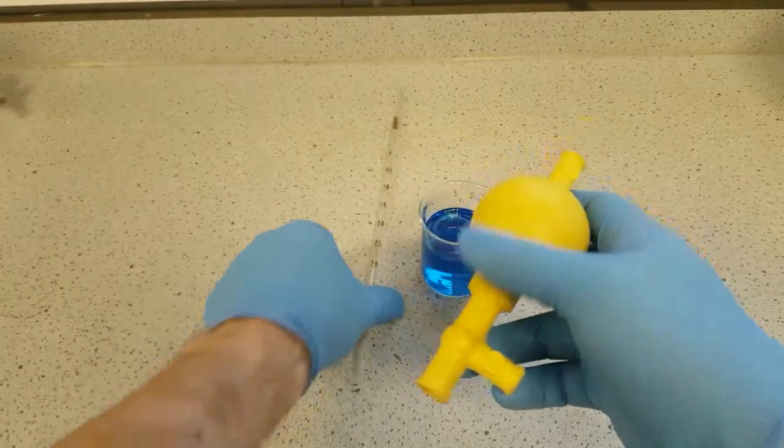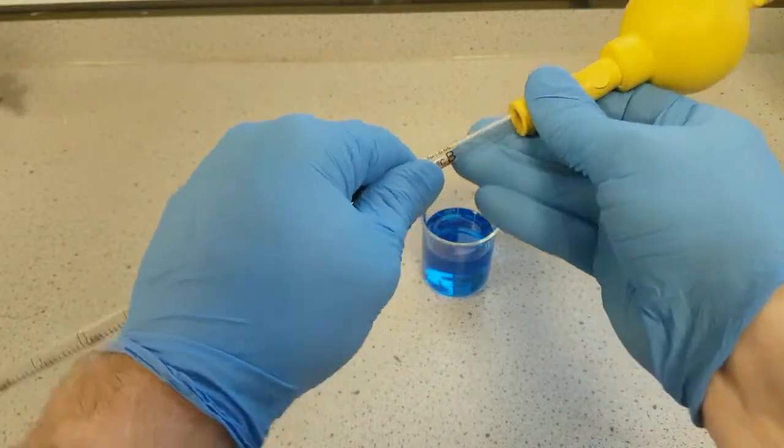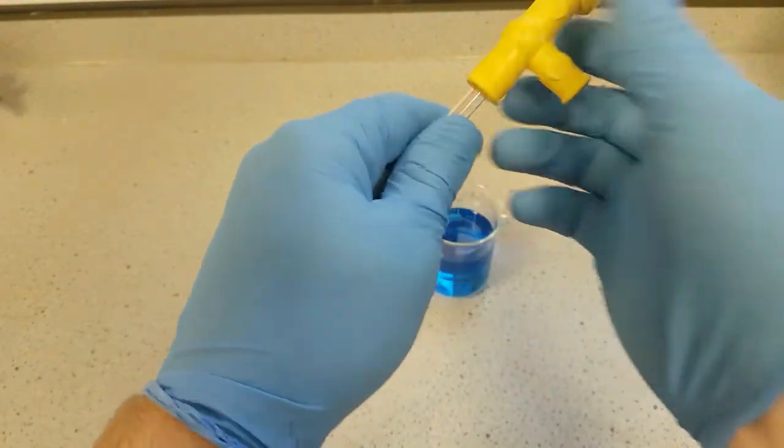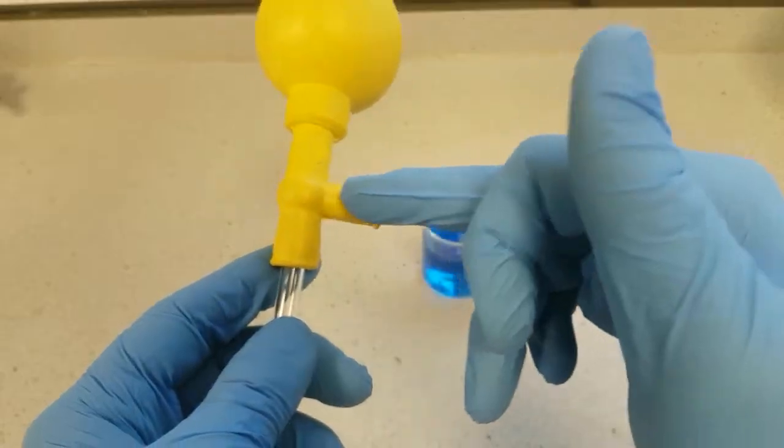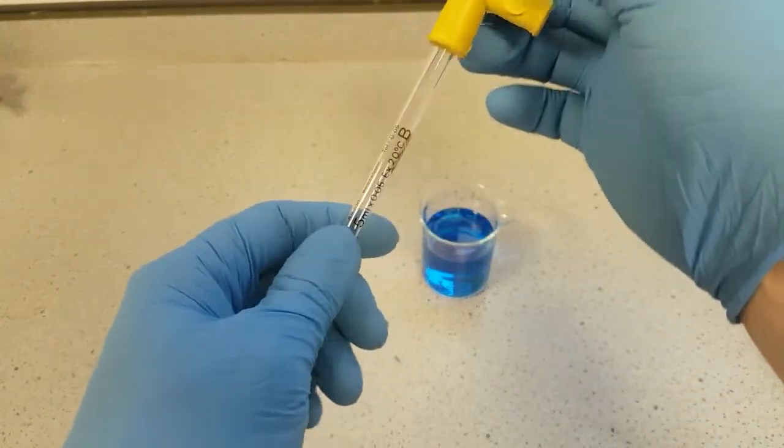Let's attach a pipette to our filler. Now don't press your pipette in too far. If it goes above this valve here then it won't work when you come to dispense any liquid.